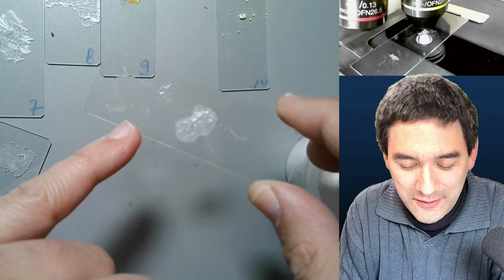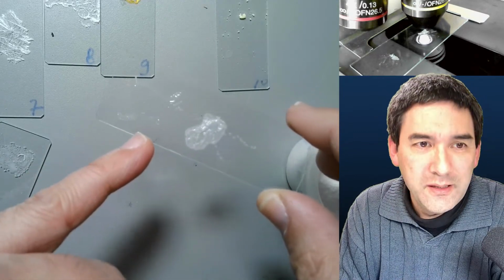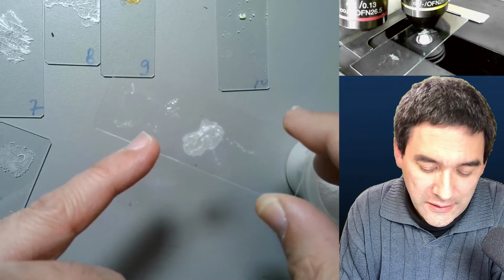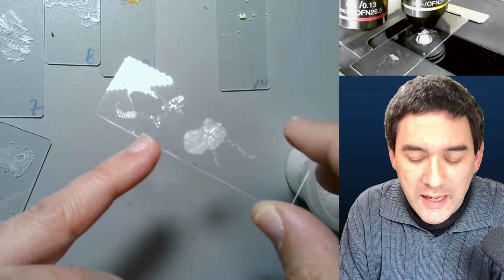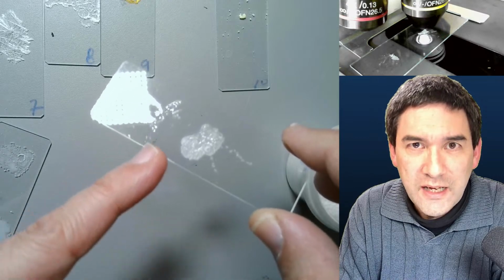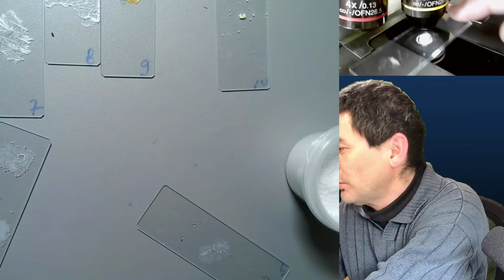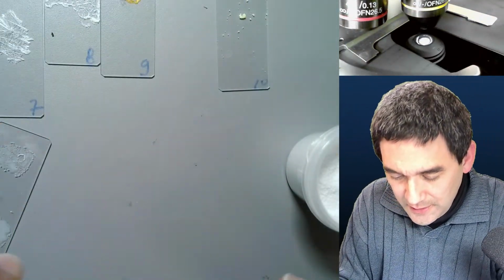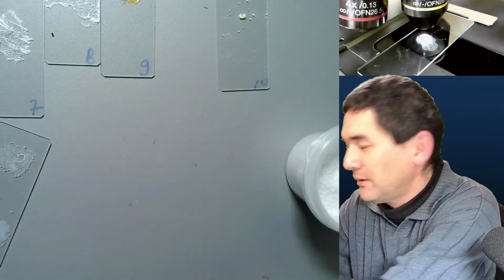It's really interesting. And as a matter of fact, it could be maybe that there were no crystallization seeds present. I don't know. So what I'm going to do is I'm going to use this wet one over here, and under the microscope, I'm going to add some more of this, to see if this can actually initiate crystallization or not. So let's put the other one, the citric acid one, away. And let's put this one in here. This is number 5, yes, tartaric acid. And squares, here we go.